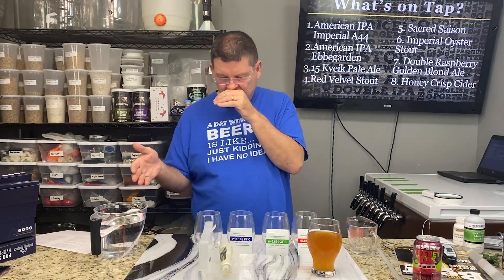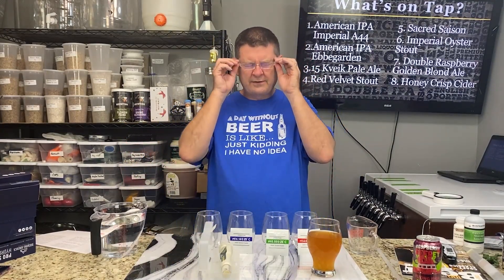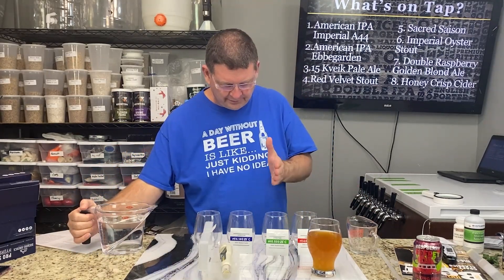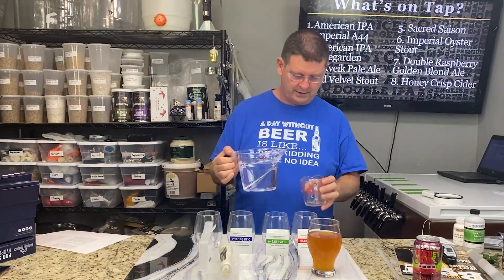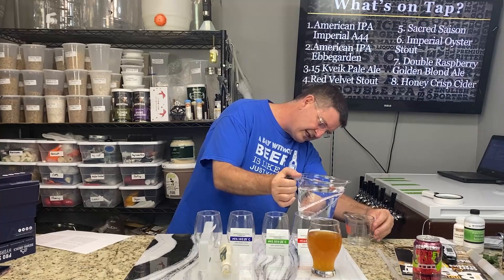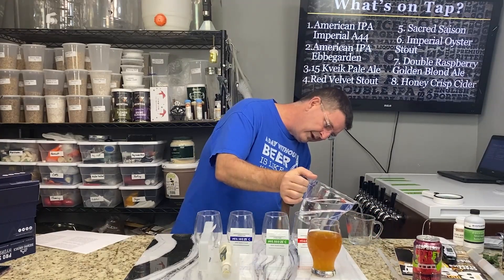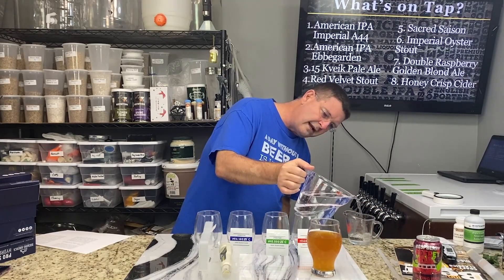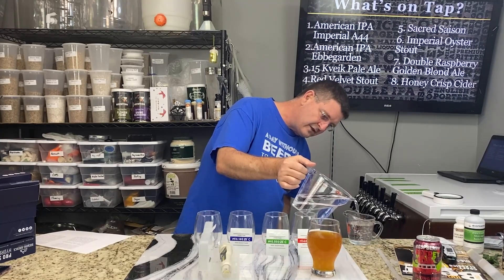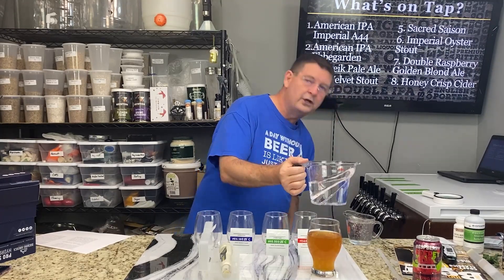Here's what you need to do: add 250 milliliters of distilled water to each of your containers and make sure your containers can hold 250 milliliters. Note that 250 milliliters is slightly more than eight ounces, so if you think eight ounces equals 250 milliliters, you're off.